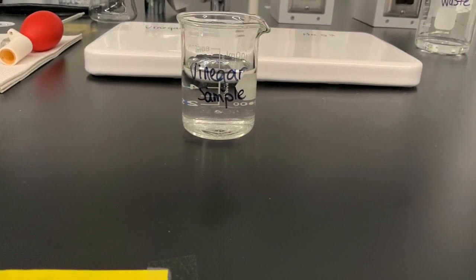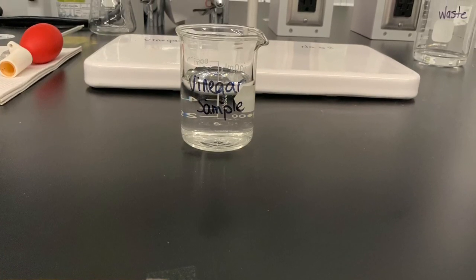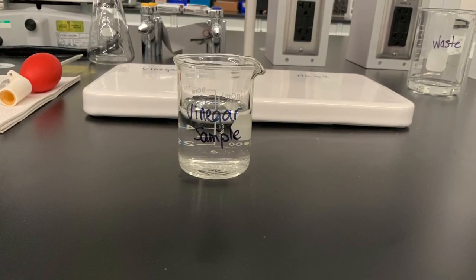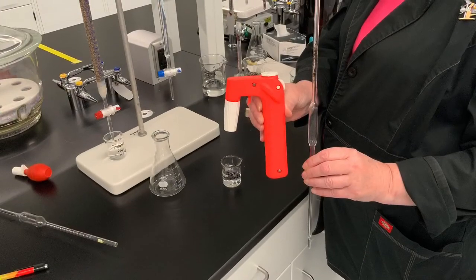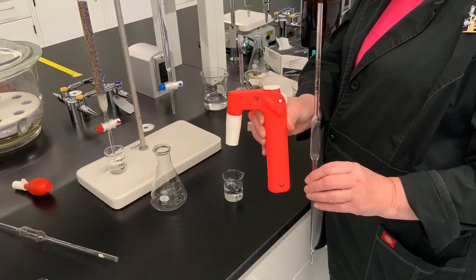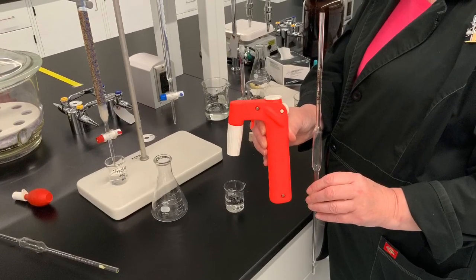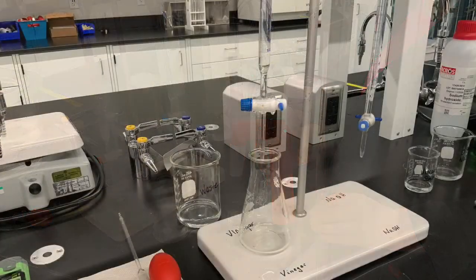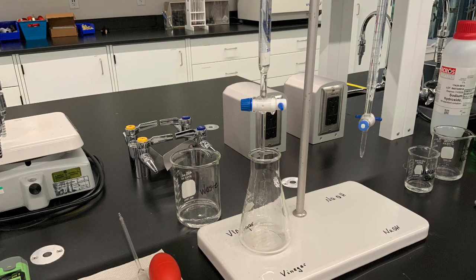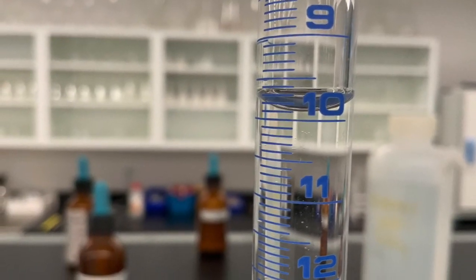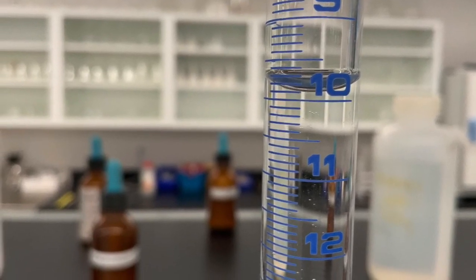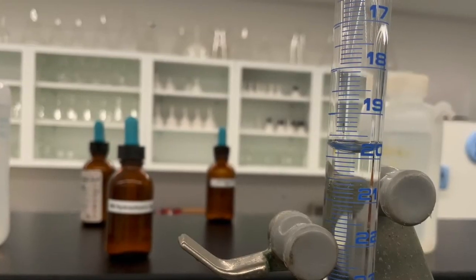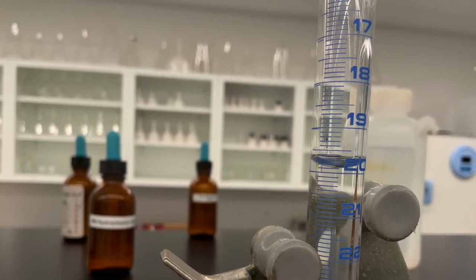The vinegar sample will be provided in a small beaker. When this video was produced, I did not know if you'd already have hand pumps available that would allow you to pipet quite comfortably 10 milliliters of the vinegar solution into an Erlenmeyer flask. If hand pumps have not been delivered when your lab starts, you can just use a burette. That means you need to condition that burette, filling it all the way up with vinegar, then releasing that vinegar into a waste beaker before you use the burette to release exactly 10 milliliters of vinegar into an Erlenmeyer flask.